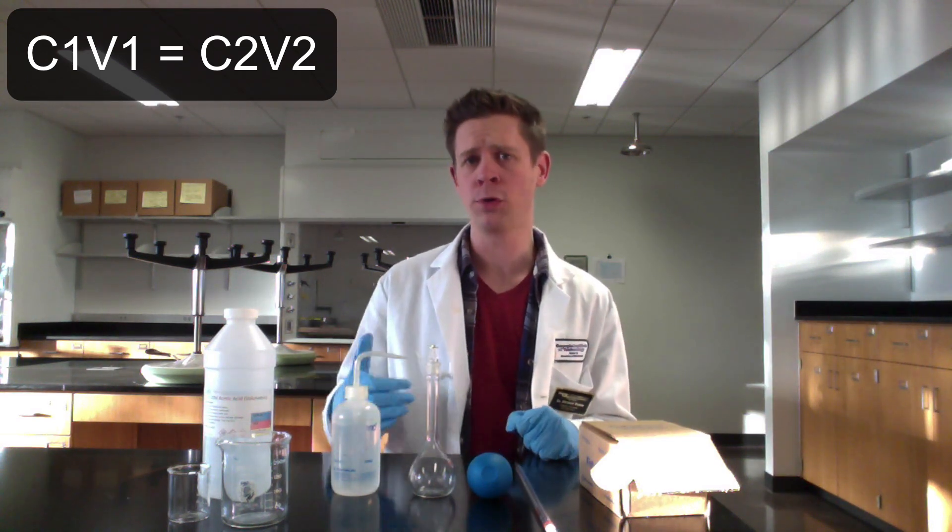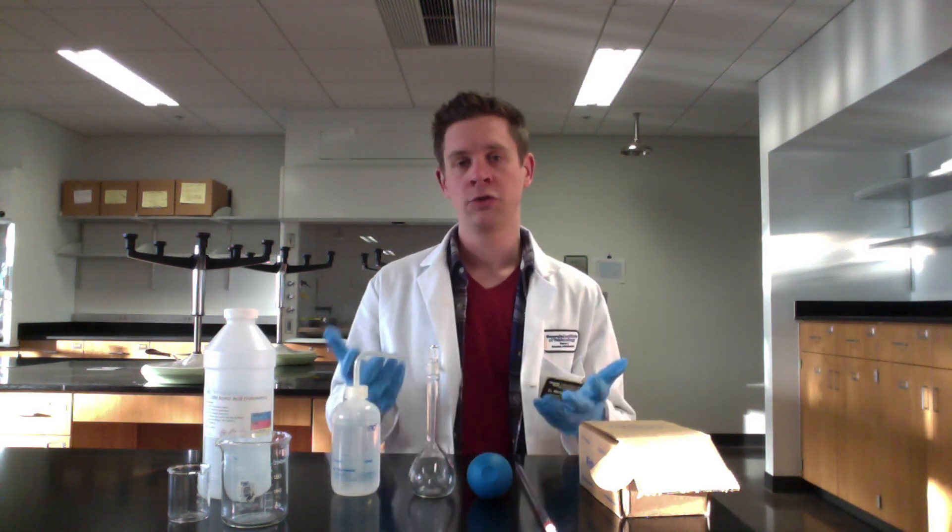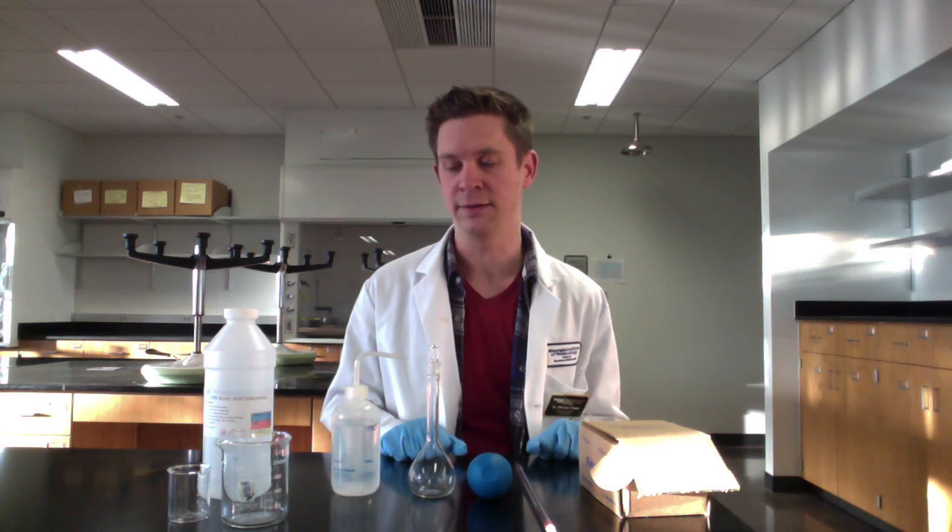C1V1 = C2V2 is an important relation when planning dilutions. If you have a target concentration in mind for a diluted solution — it has to be less than the stock — you can use this relatively simple relation to figure out what volume of stock you need to produce a particular target concentration and volume for the diluted solution. So let's look at how this process works operationally and practically in the laboratory.